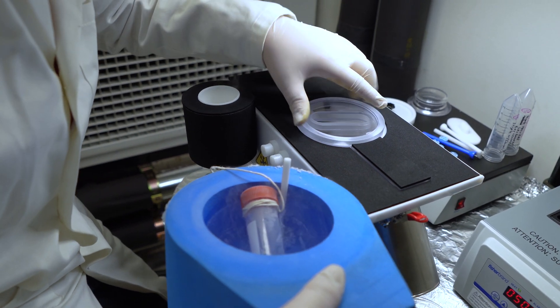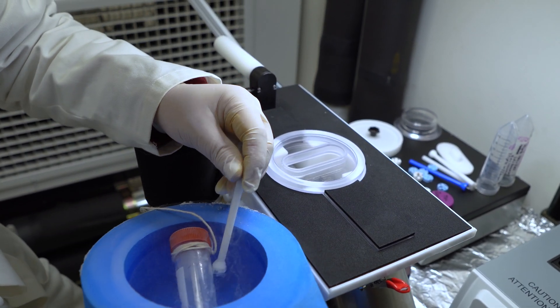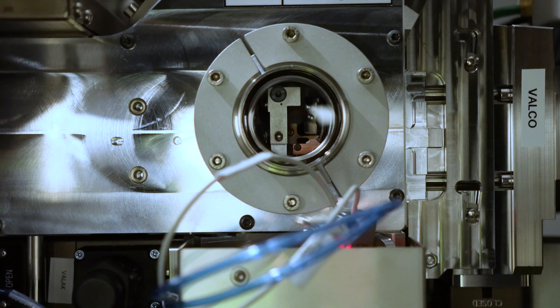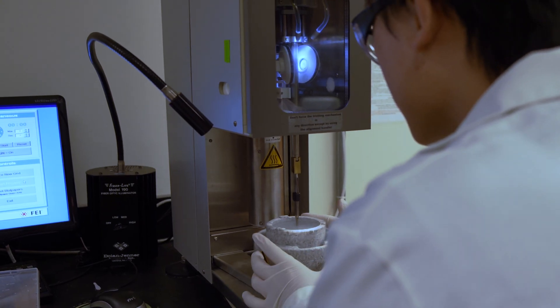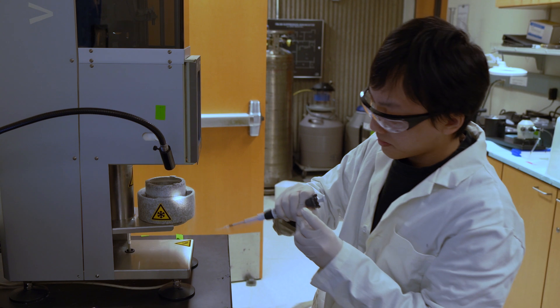People coming to UC Davis can get in on the ground floor by getting training and the ability to actually operate machines directly and to process data that, until recently, has just not even been possible to get. Having this technology on campus is a critical component to training modern-day biologists.